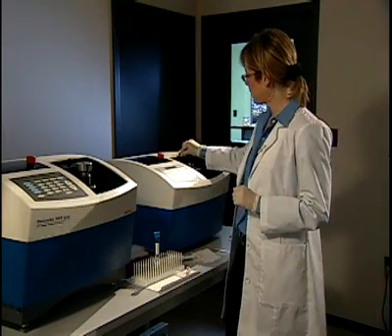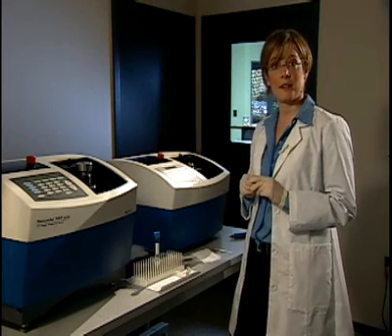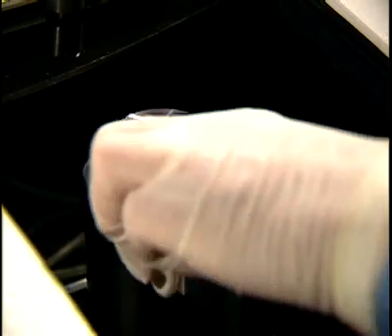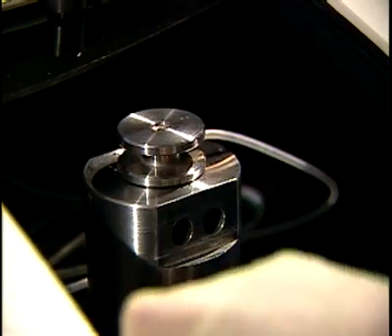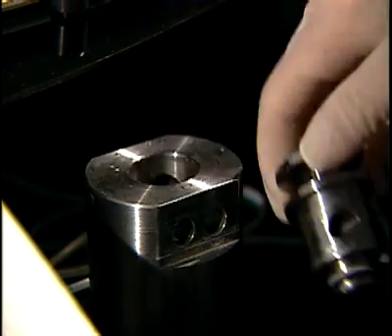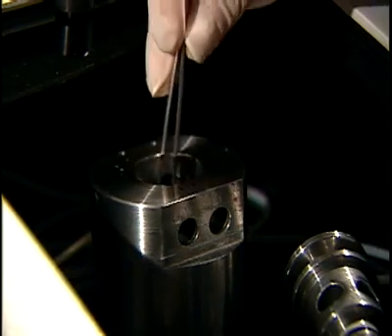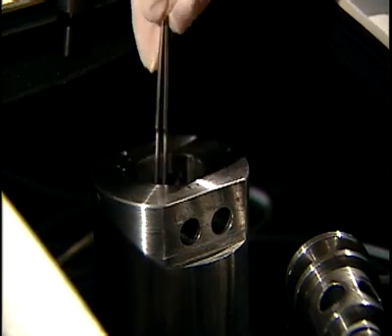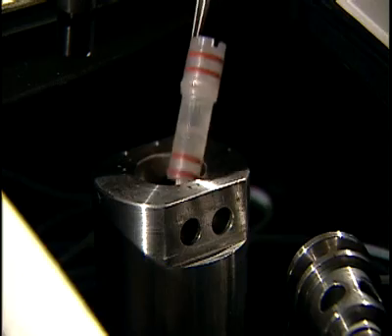The PCT process quickly and effectively releases nucleic acids and proteins. When the process is finished, I remove the pulse tube from the barocycler reaction chamber, remove the supernatant that contains the extracted biomolecules with a pipette, and then prepare to begin my downstream testing.